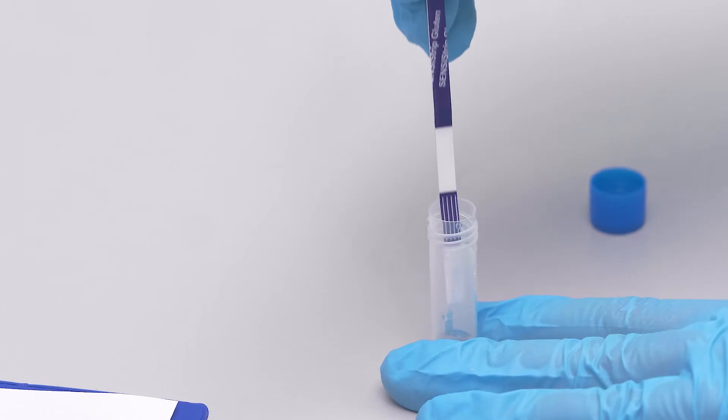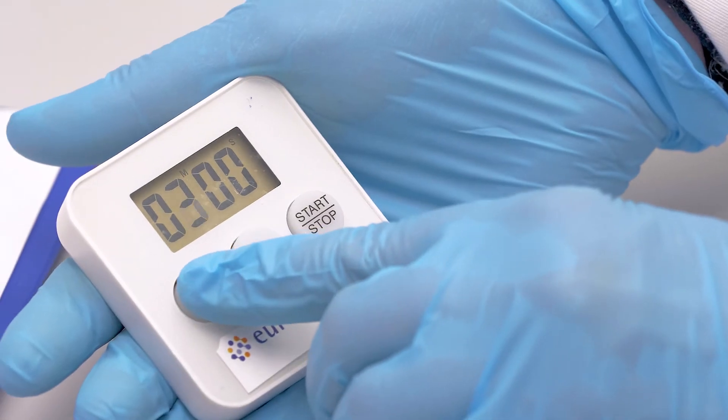Then insert a strip into the reaction vial with the arrow pointing down. Wait five minutes.